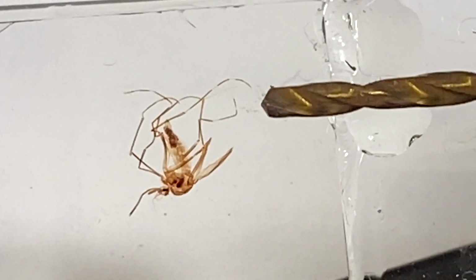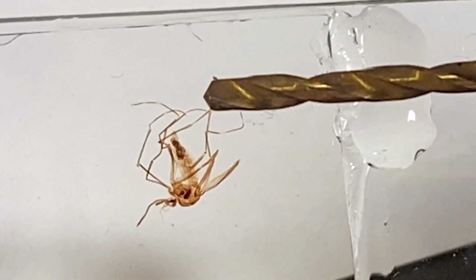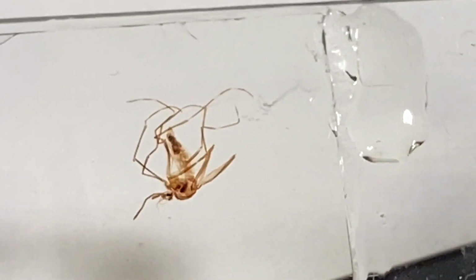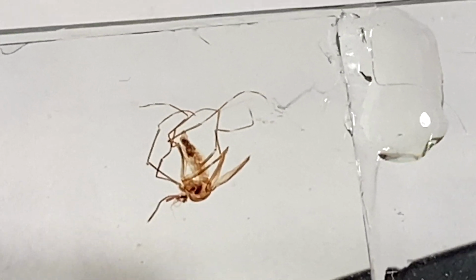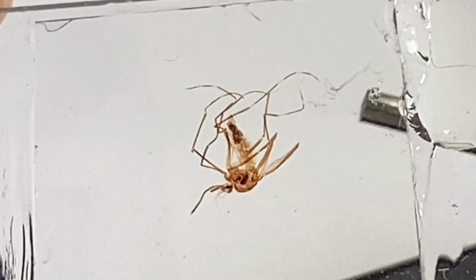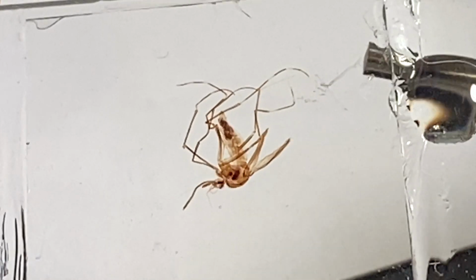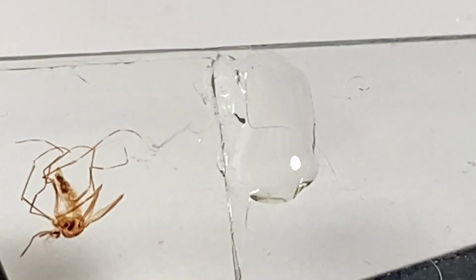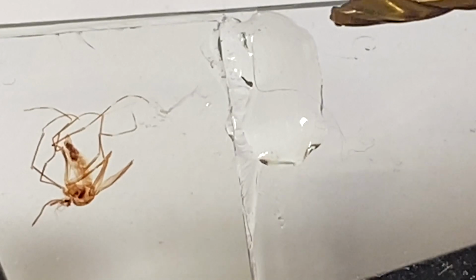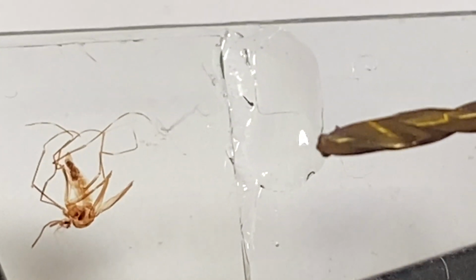You put it underneath. If you put the heating tip over here near the edge, it will reliquefy the resin over here, so the bubble will want to move into the area there. Now around here it's all hard, so it won't move that way, it'll move this way. So if you're going to heat the slide, you might want to first heat this area to liquefy the resin again, then put the heating tip under the bubble, and then it will move into the liquefied portion. And then once the slide has cooled down, it will draw back some of the resin that we put on the outside, the reservoir, because the bubble isn't there anymore. So that space has to be taken back up again with the resin.